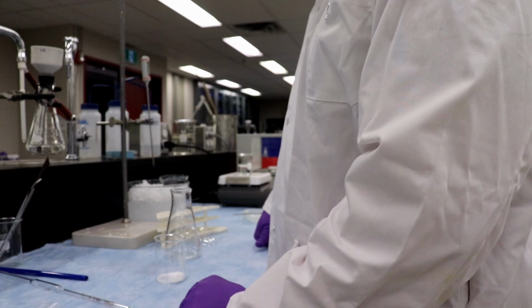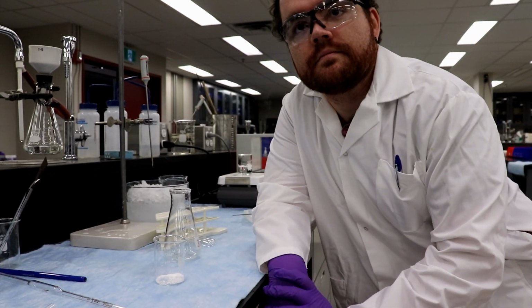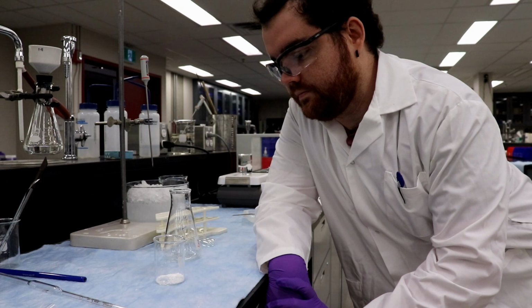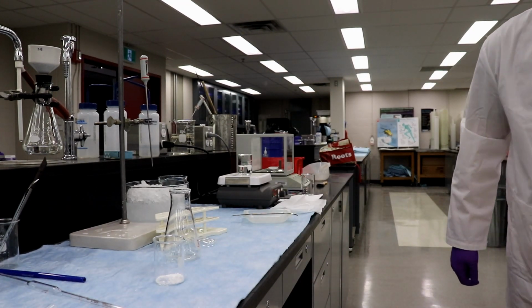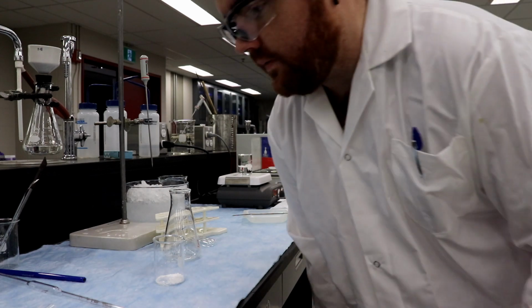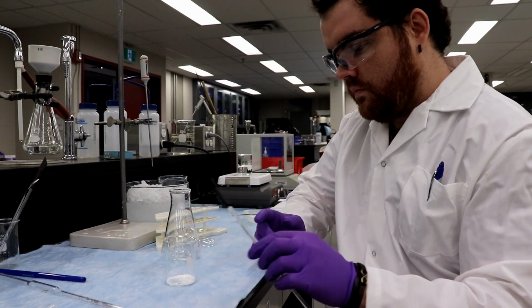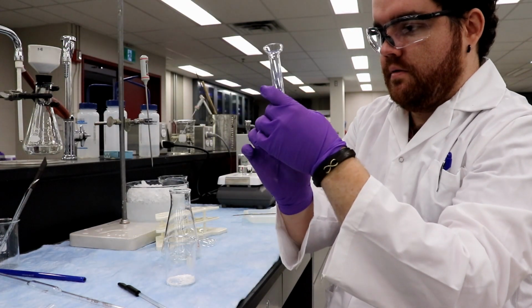Can I interject for a second? Sure. We want to use the smallest amount of water possible as the solvent to dissolve the ASA crystals. So we're not going to use 10 mils. We're going to use a dropper, the plastic dropper I have in front of me, and add it slowly until it is dissolved. Or do you want to measure out 10 mils in a graduated cylinder just to know that we haven't gone above it? It's a good idea. Let's do that. So we'll take our graduated cylinder, that's a clean one.